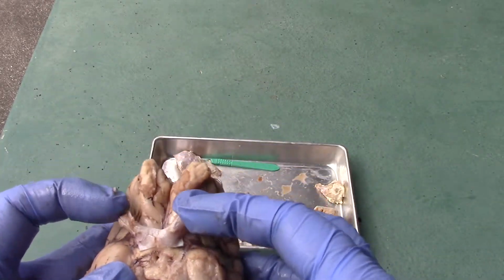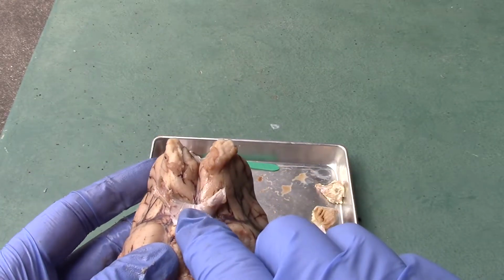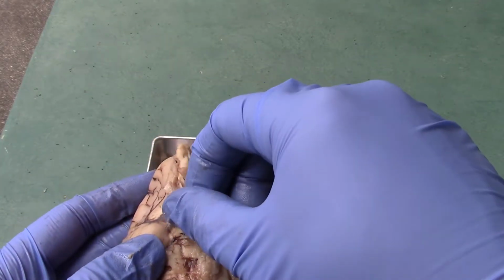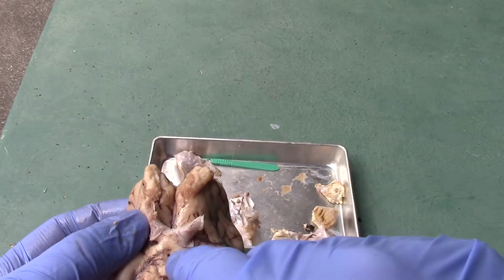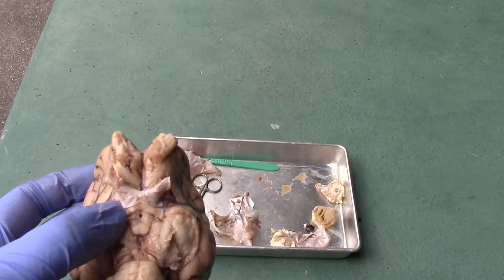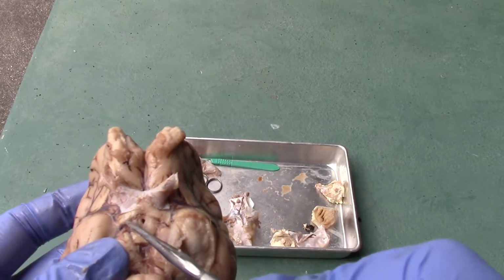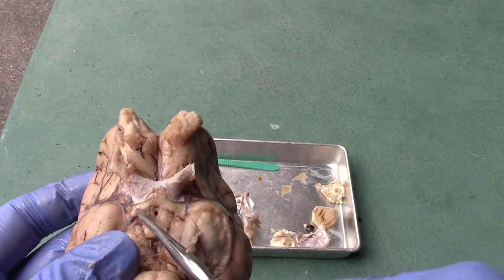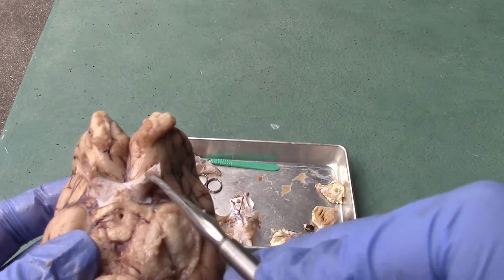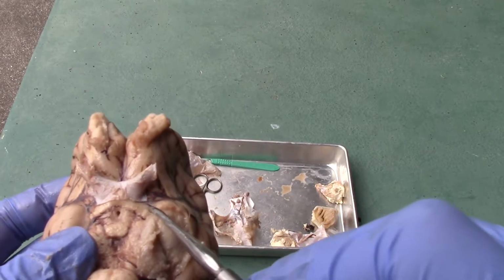We have the optic nerves that you see here on either side, and right where they connect right here is the optic chiasma. Okay, and if we go posterior to it, notice how it splits up again on either side. Let me use a little pointer here. Right, on either side over here. This side over here and this side over here would be the optic tract. So optic nerves, optic chiasma, and then optic tract.